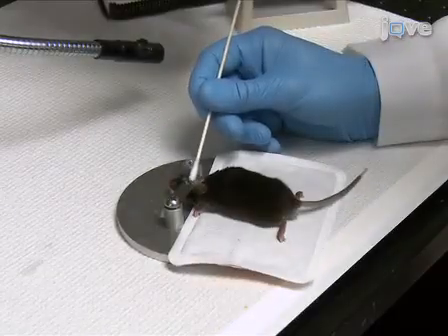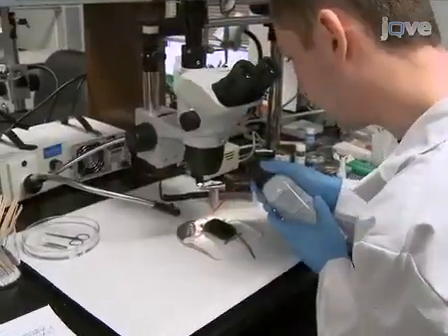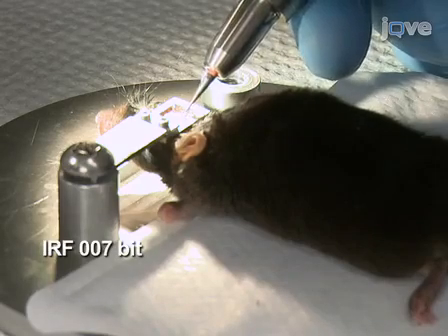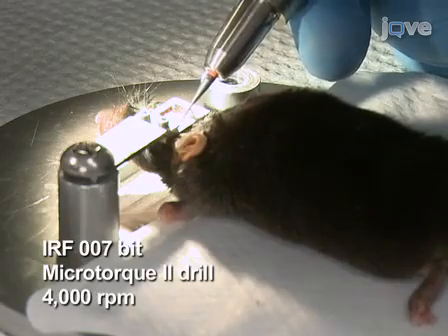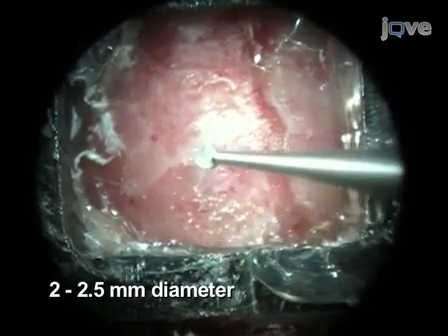In preparation for thinning, dry the skull using a combination of sterile cotton swabs and compressed air. Thin the skull using an IRF 007 drill bit in a microtorque 2 drill at 4000 RPM. Very gently, begin thinning a 2 to 2.5 mm diameter circular area.